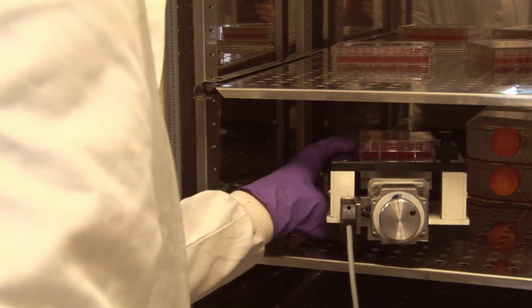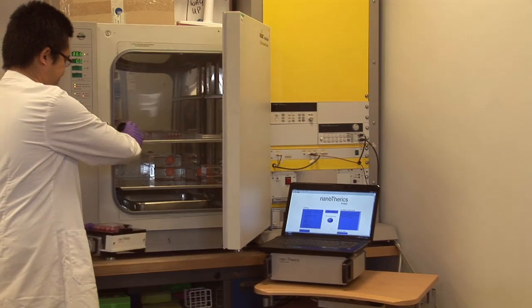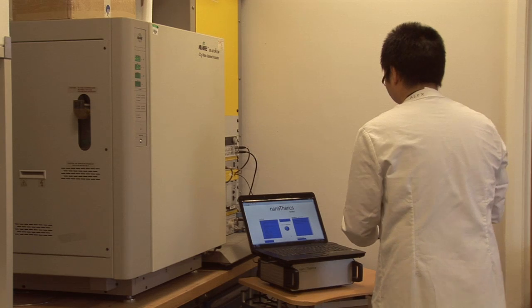Upon completion of the experiment, remove the transfected cells and cultivate under standard conditions until evaluation of transgene expression.